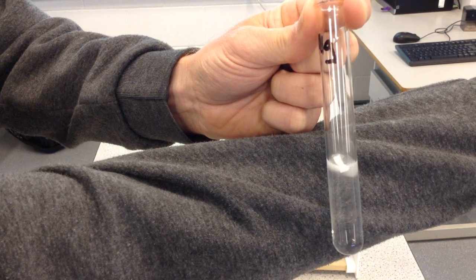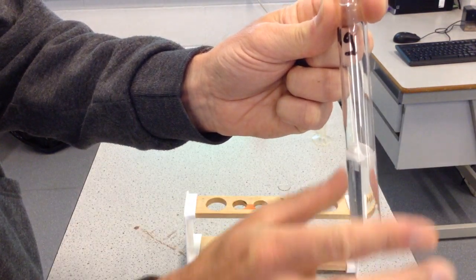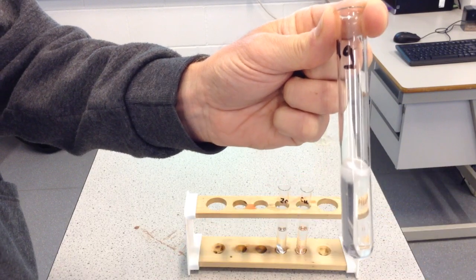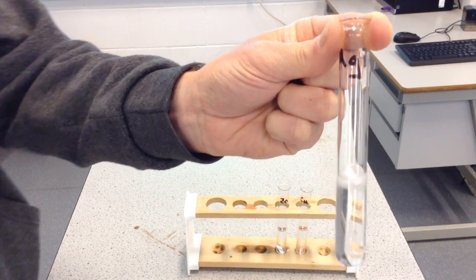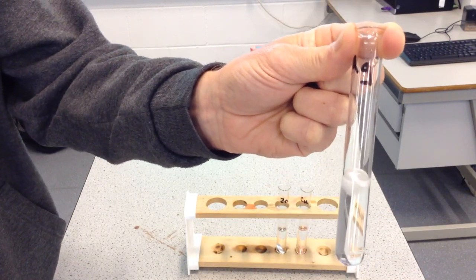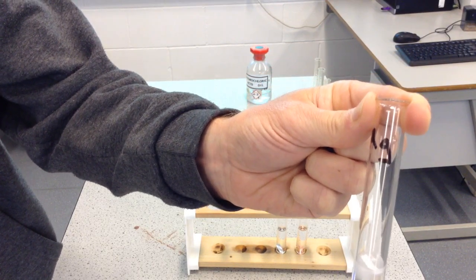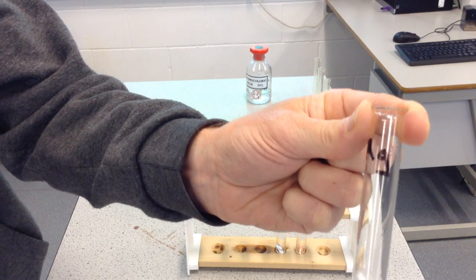Now, the magnesium is also beginning to dissolve. And the other thing I'm going to do is check, yeah, that's really quite hot. So this reaction is called an exothermic reaction. It's releasing heat. Heat is exiting into the surroundings, so that's quite hot. So there's some clear signs of a reaction there.